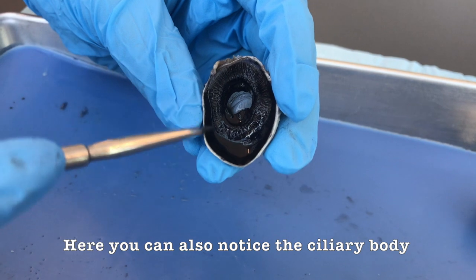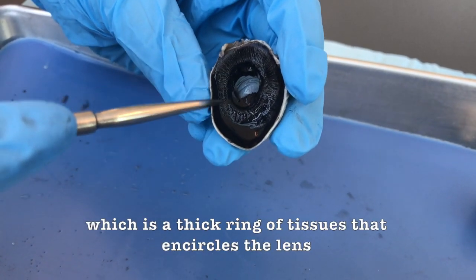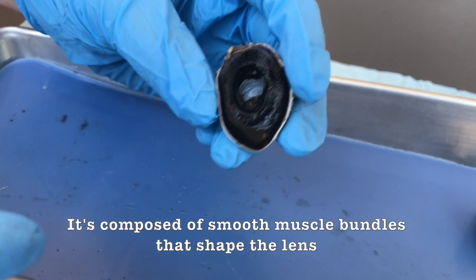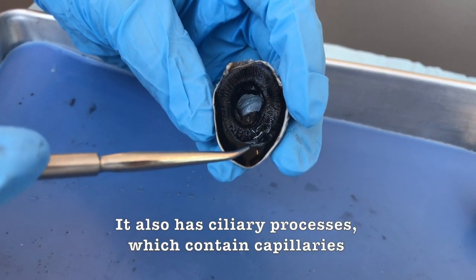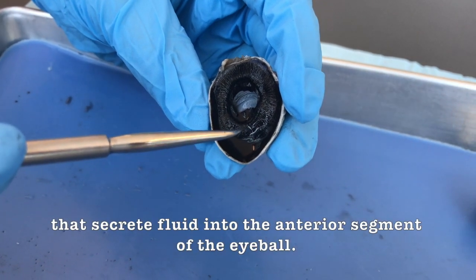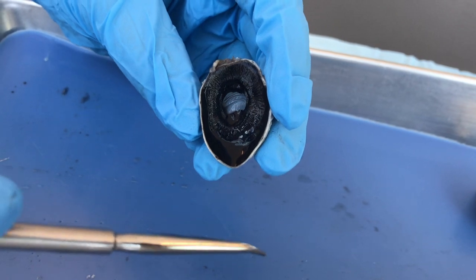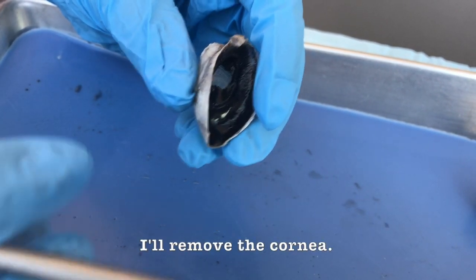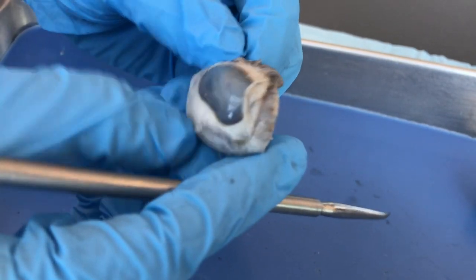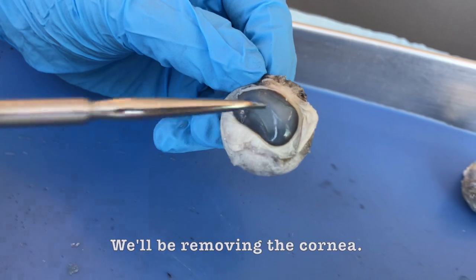Here you can also notice the ciliary body, which is a thick ring of tissues that encircles the lens. It's composed of smooth muscle bundles that shape the lens. It also has ciliary processes, which contain capillaries that secrete fluid into the anterior segment of the eyeball. So to gain an appreciation of the anterior segment of the eyeball, I'll remove the cornea. So if we flip over to this side, we'll be removing the cornea.